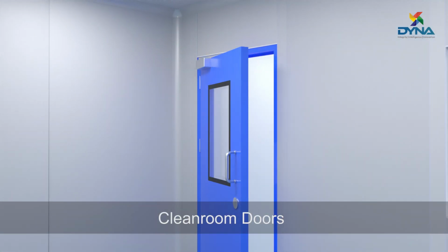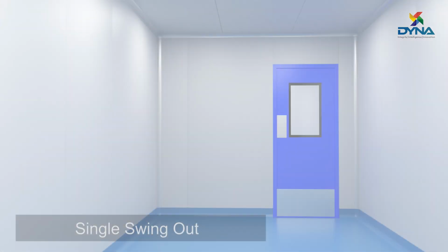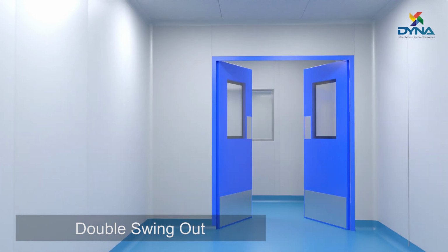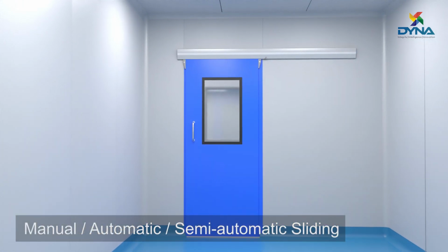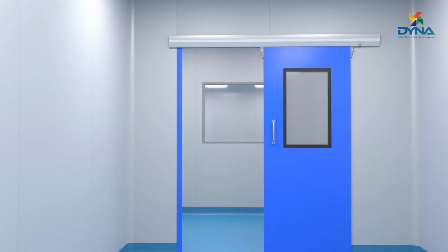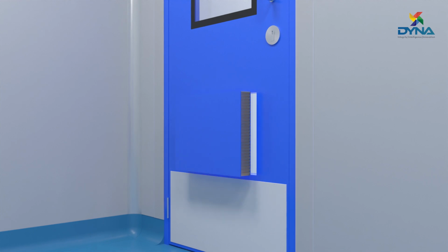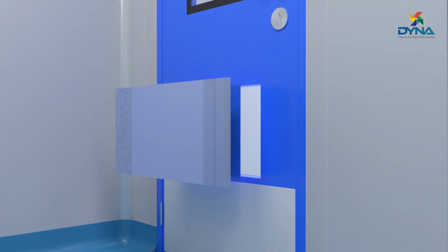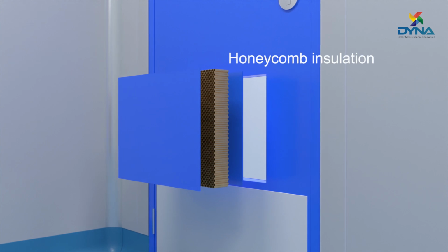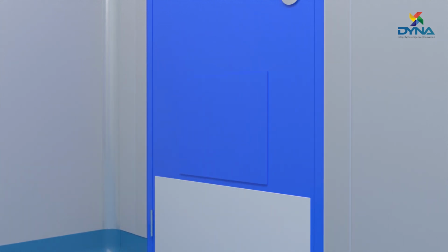Dyna's cleanroom doors are fully flushed surfaces with wall partitions. The doors come with both single and double swing out configurations, or as horizontal sliding with manual, automatic, and semi-automatic configurations. Finished with a conveyorized powder coating facility, they come in pre-coated or powder-coated galvanized iron, aluminium, and stainless steel materials of construction with honeycomb, polyurethane foam, and Rockwool infill for insulation.